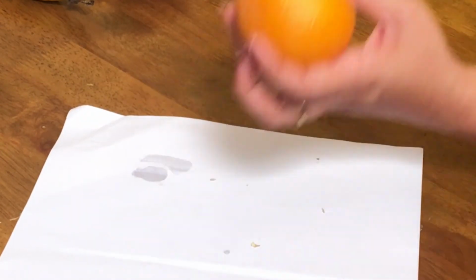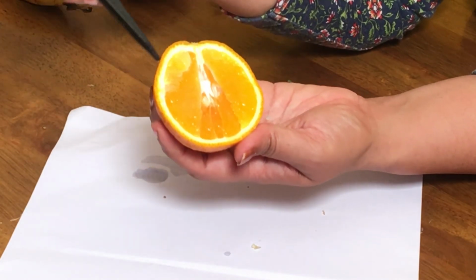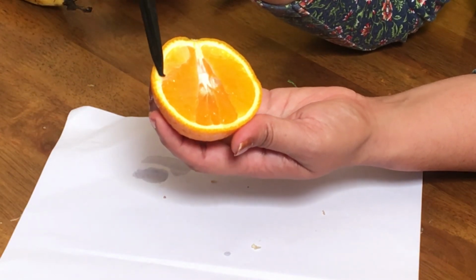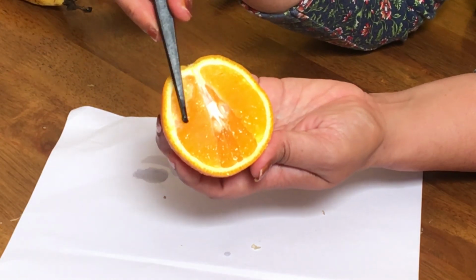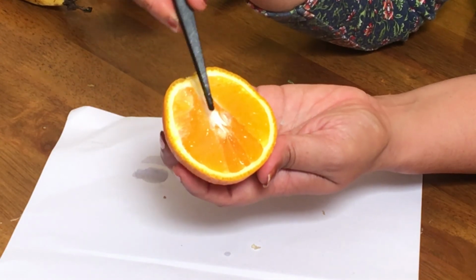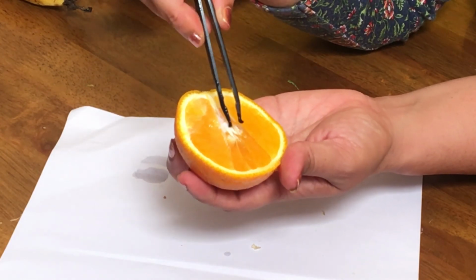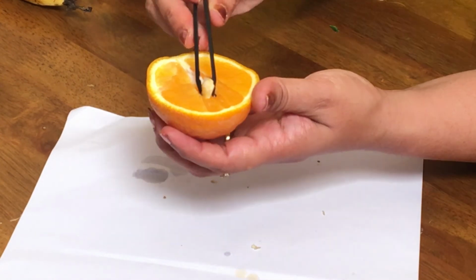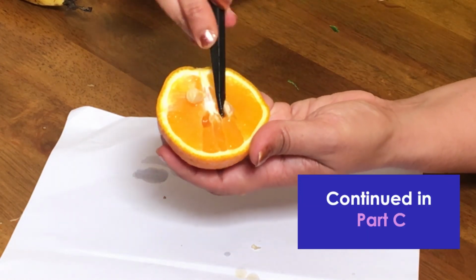This is a hesperidium. The orange outer leathery rind is the epicarp. The white part is the mesocarp, and these thin transparent layers are the endocarp, which has a lot of fine hairs which are juicy and sweet and sour in taste, giving the citrus flavor. So this is the endocarp with the hairs, and inside you will be able to find the seeds. So seeds are placed inside. You can find the seeds like this inside. This is also a simple fruit.